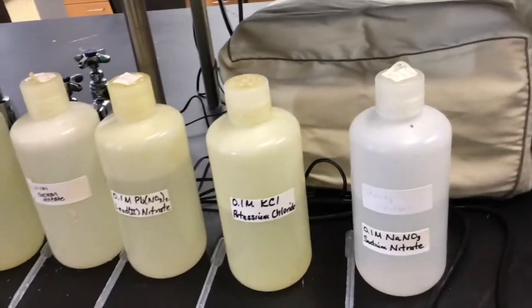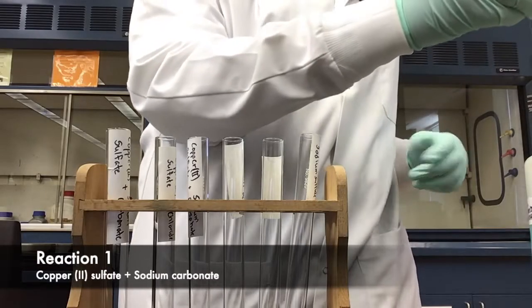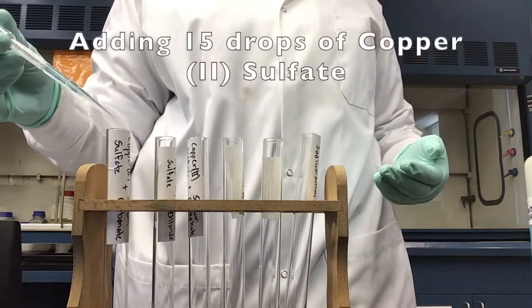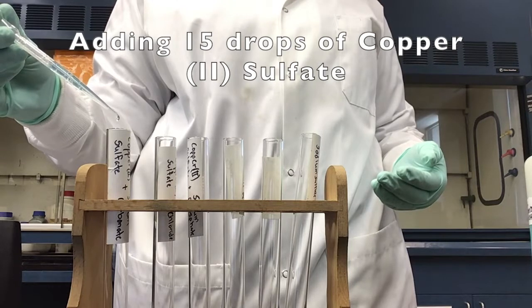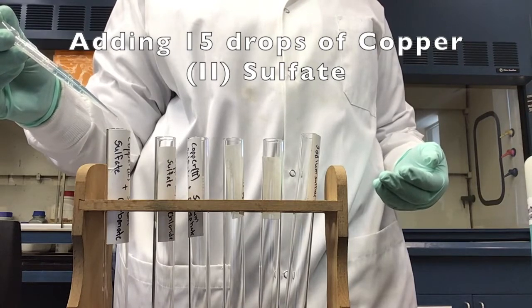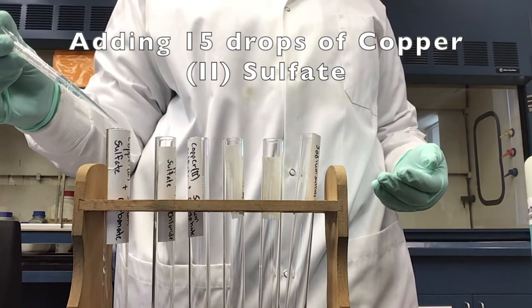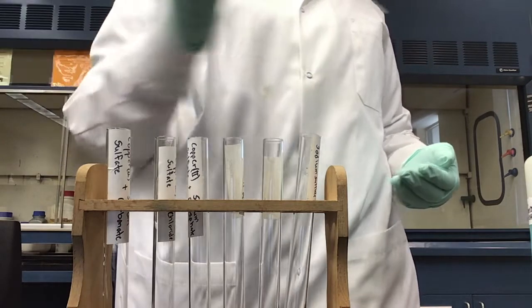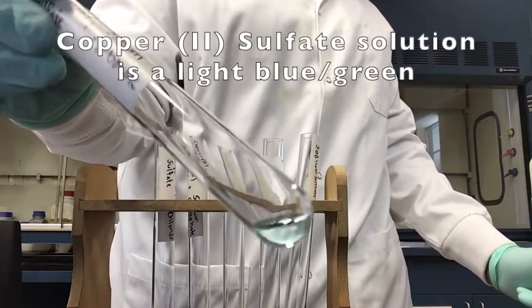and gloves. Our first reaction today is copper 2 sulfate and sodium carbonate. We're going to start off by adding 15 drops of copper 2 sulfate to our first test tube. Copper 2 sulfate has a light blue color by itself.